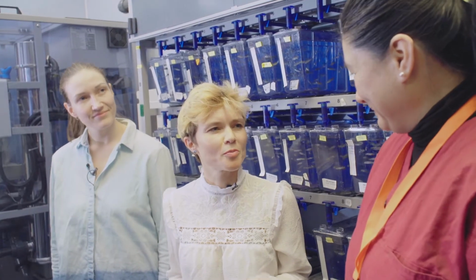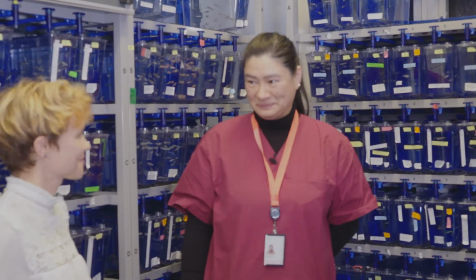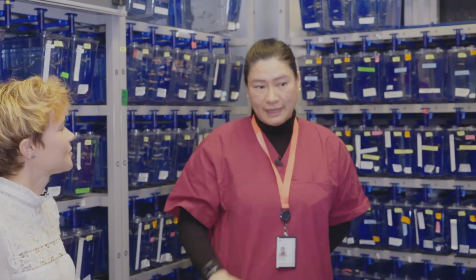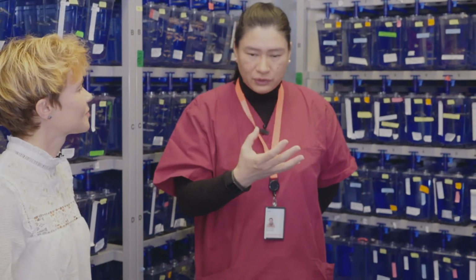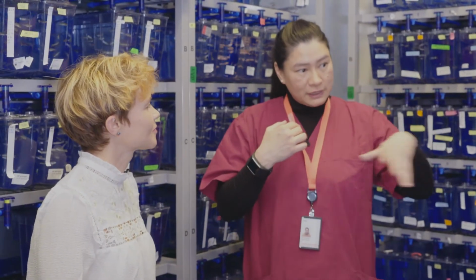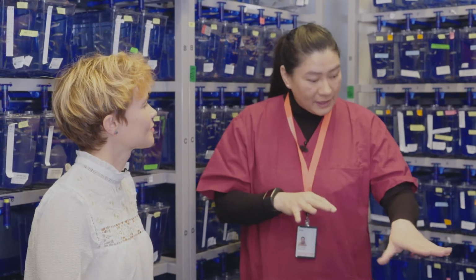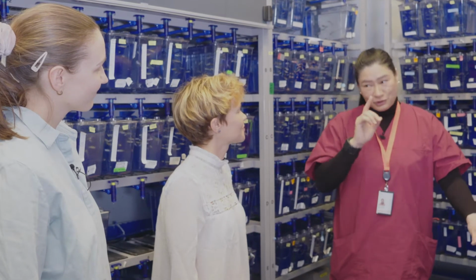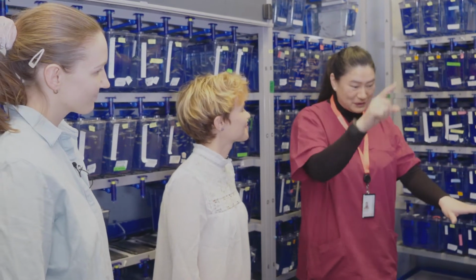So what's the most important parameter to control when you take care of zebrafish? The water quality. We have been investing a lot of time and research to give the best conditions for the fish, not only the temperature or the pH, but also the hardness and the byproducts of the fish metabolism, to keep this in balance, having our systems supported by the biofilter. So if you're asking who is living in your system, it's not only zebrafish, it's the complete symbiosis with the good bacteria.